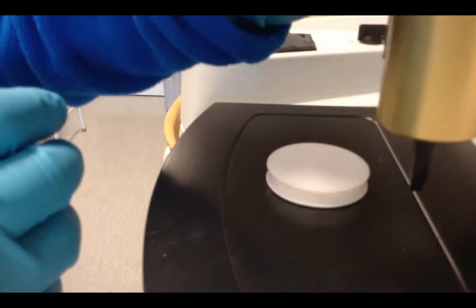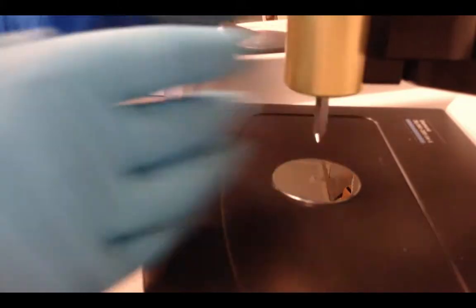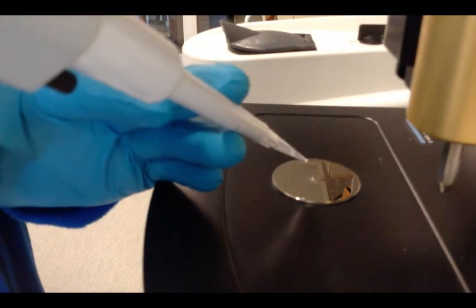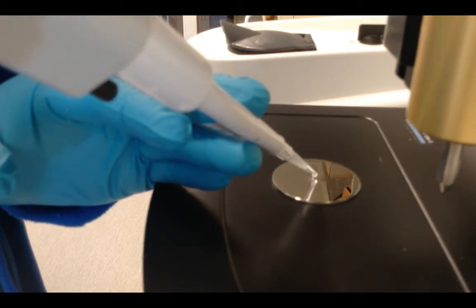Load the tip on the plastic cover. But to do this, you need to change the tips from this powder tip to a long pointed tip, and then just drop your liquid sample on the diamond.